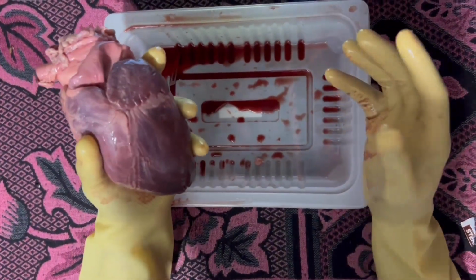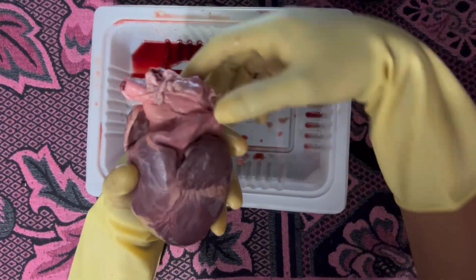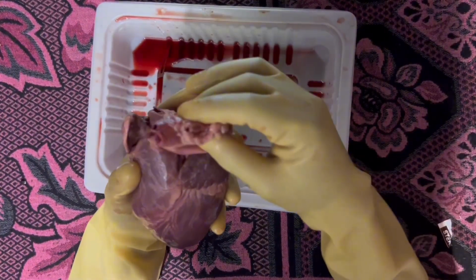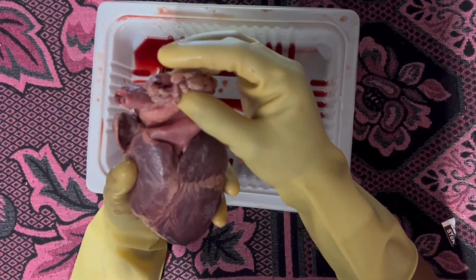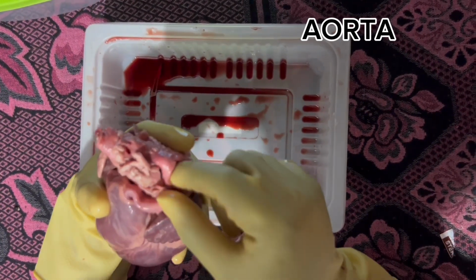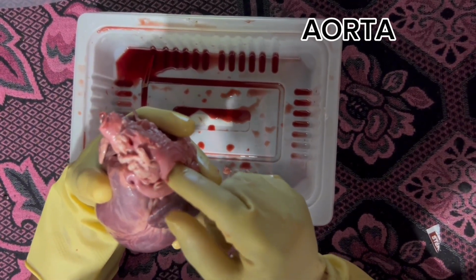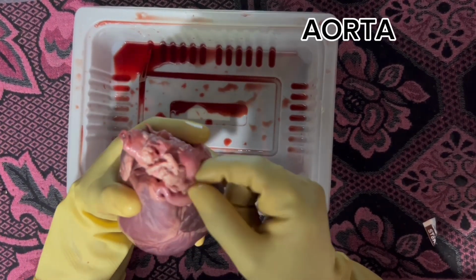After identifying the chambers, we will move on to the blood vessels. This is the blood vessels. Here, we can see a thick tube called the aorta. This is the aorta. So, the aorta is a large, cane-shaped vessel that delivers oxygen-rich blood to your body.